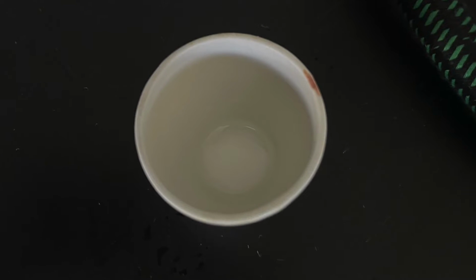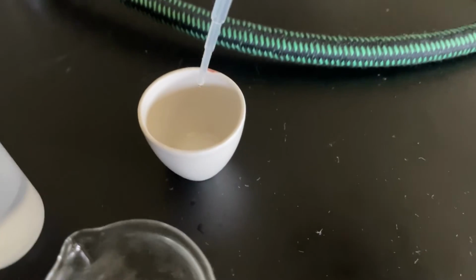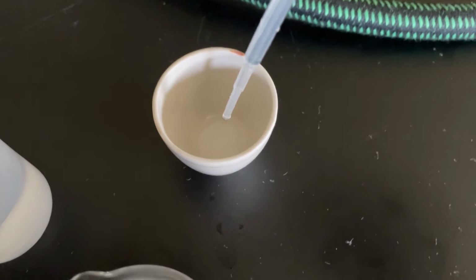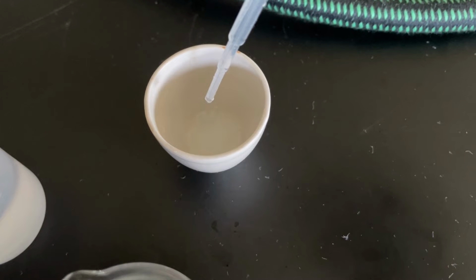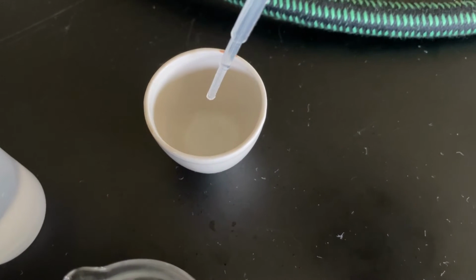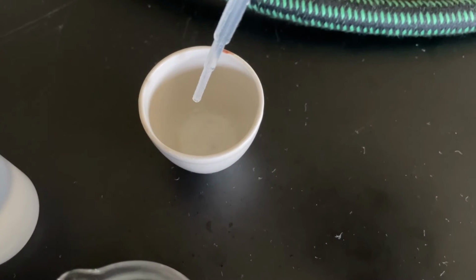we're going to go ahead and start the chemical reaction by adding a very controlled bit of hydrochloric acid. But remember, we need this hydrochloric acid to be in excess. So we're going to complete the chemical reaction with HCl. We'll even add a little bit more HCl just to make sure that all of our reactants for the carbonate have been completely reacted with the hydrochloric acid.